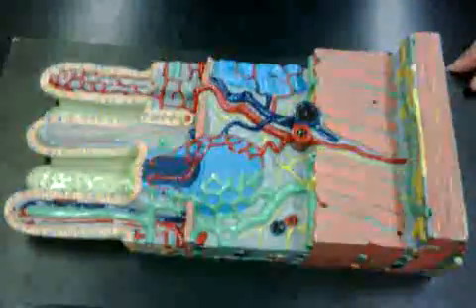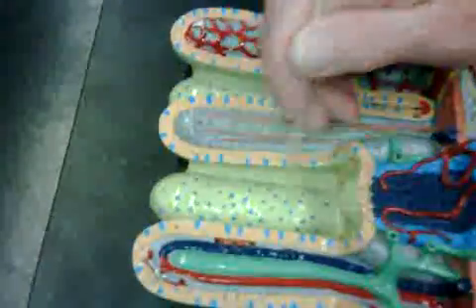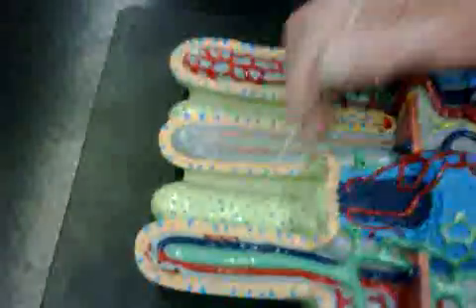The order in which it appears there, just call it off to me and I'll point. Alright, the villi. Any one of these things would be, what I usually do is I put a piece of tape here with an arrow up and an arrow down and I say identify. So that's a villus. These things in the middle. Well, this too. It's just that here I have the inside details. The villus itself, I would use this.